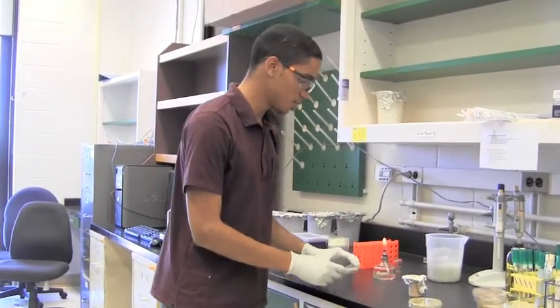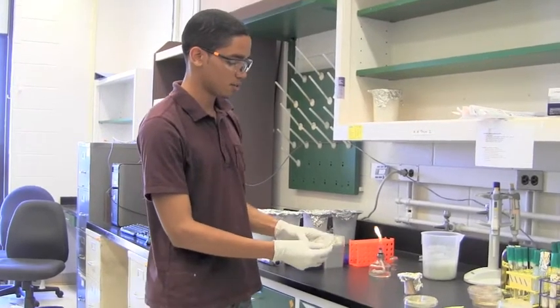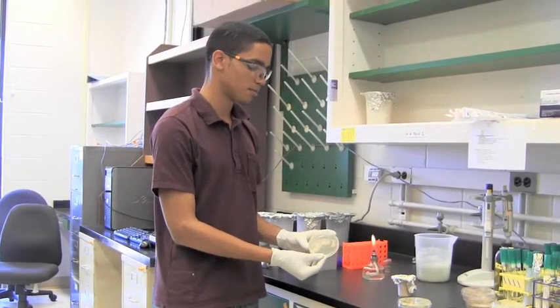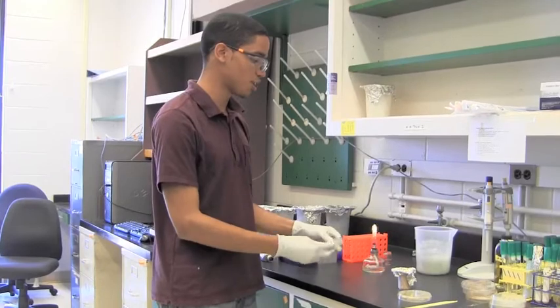So what you'll need is a freshly made spread plate of your tester strain.